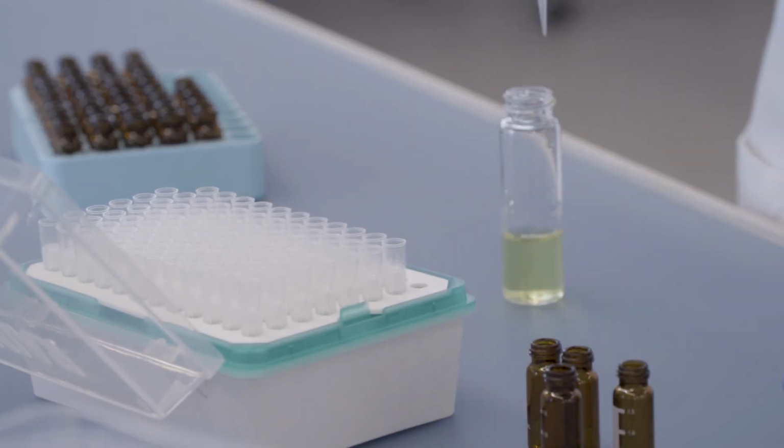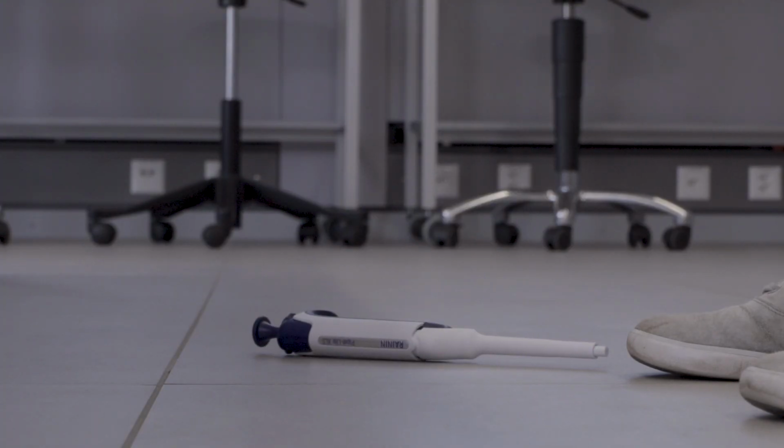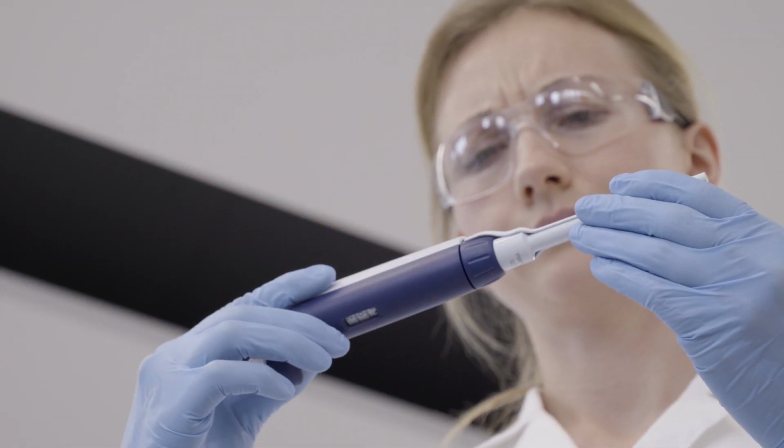Was the pipette at fault? Could something have happened to your pipette? It could have been dropped. It happens. It's probably out of tolerance now and you know what that means.